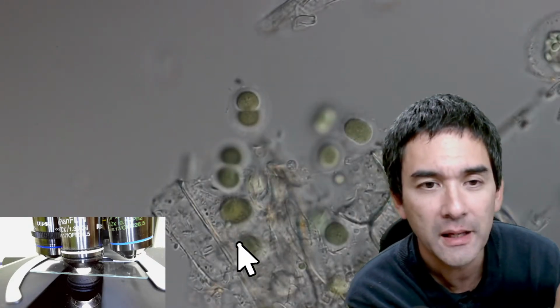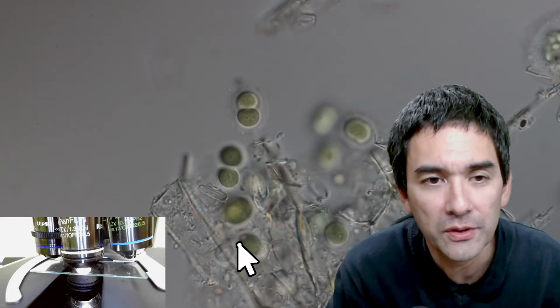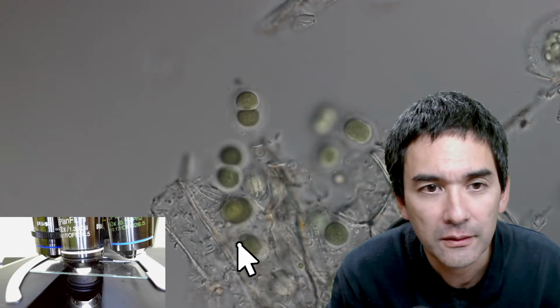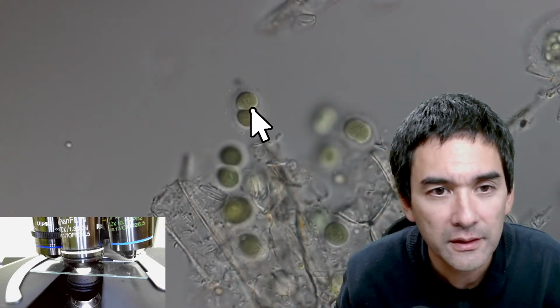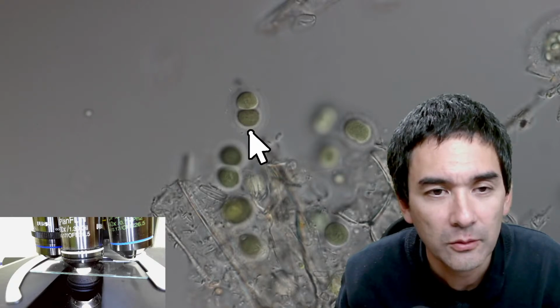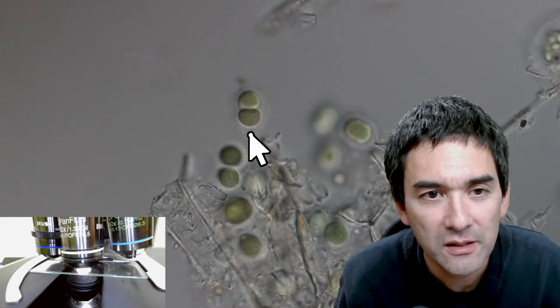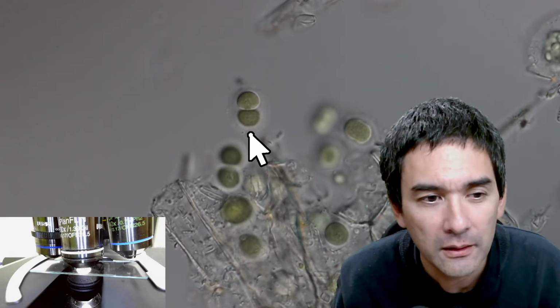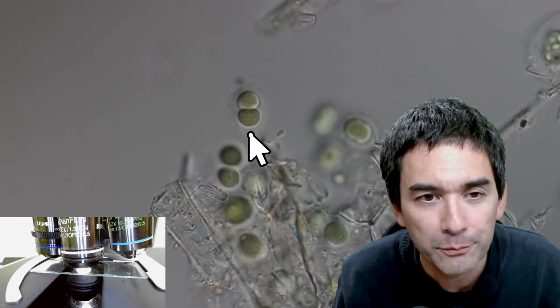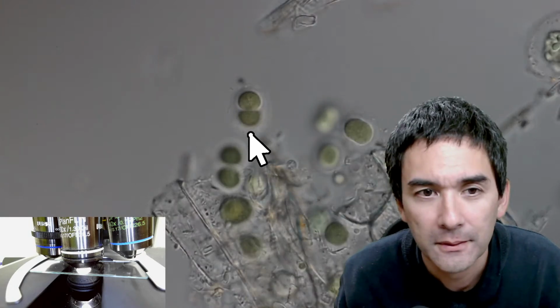Something that I also sometimes notice is the following: when you move, then the focus, for example, look at this guy over here. Okay, look when I focus. Yeah, do you actually see it move? And the reason why it moves is because of the oil, and so there is a very tiny amount of pressure being applied on the cover glass. Yeah.